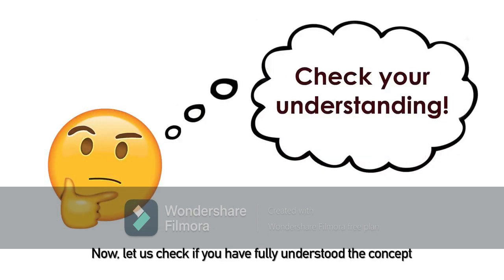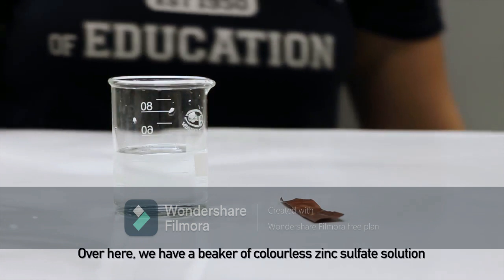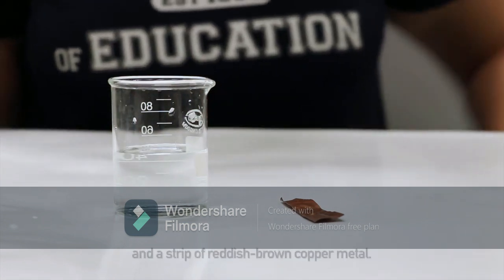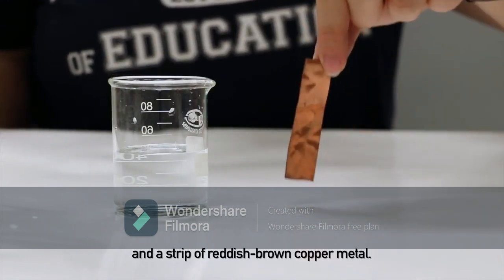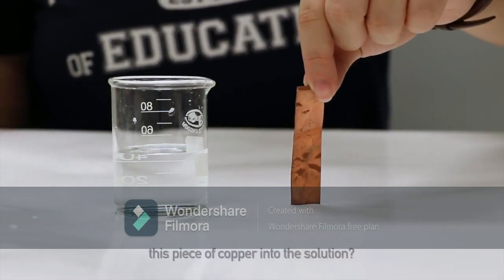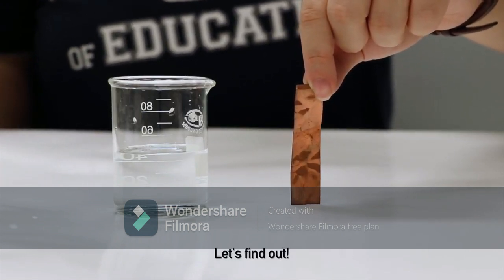Now, let us check if you have fully understood the concept of the reactivity series of metals and how it directly affects the displacement reaction of metals. Over here, we have a beaker of colorless zinc sulfate solution and a strip of reddish-brown copper metal. What do you think will happen if we were to place this piece of copper into the solution? Let's find out.